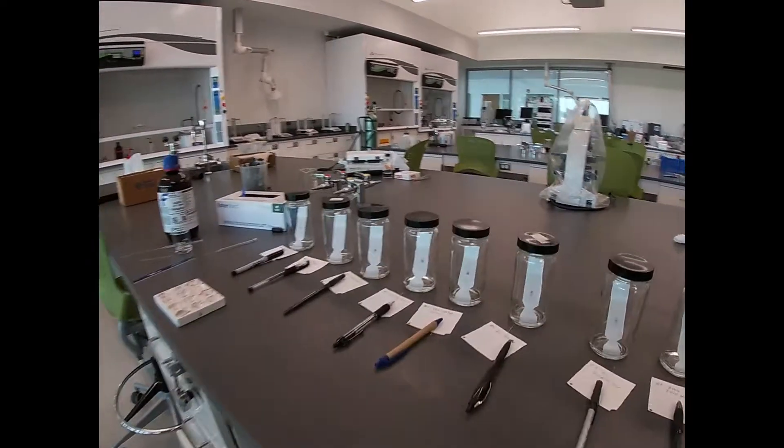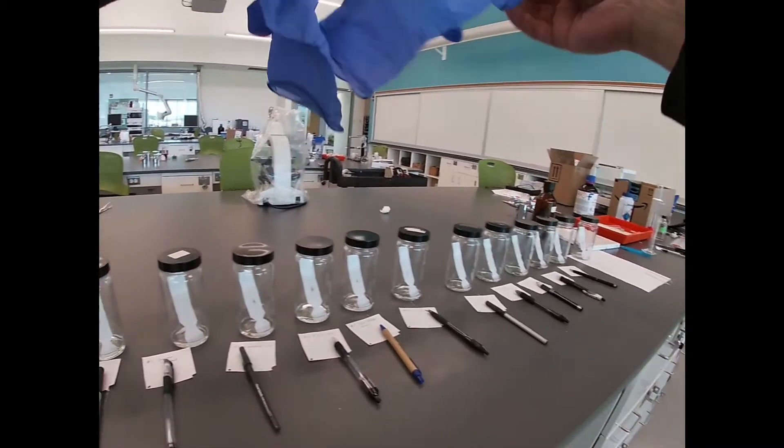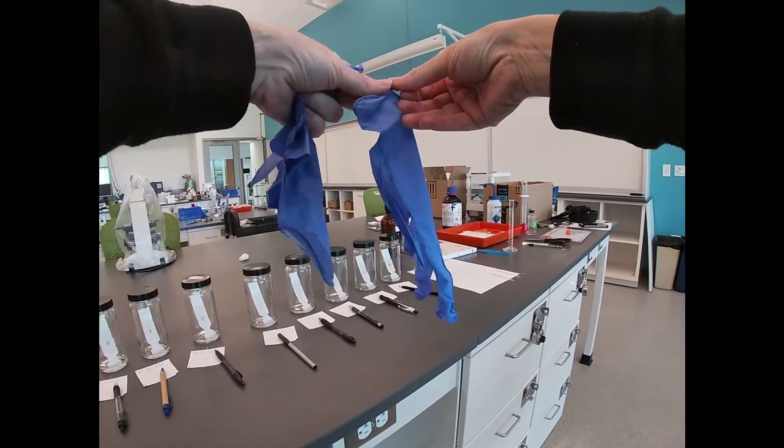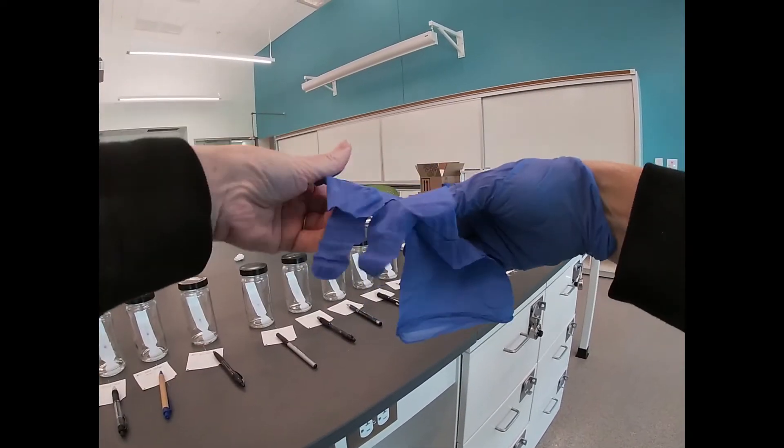All right, so it looks like our separations are just about done. Let's put on some gloves, pull these out, and we need to mark the solvent front, and we can let them dry and make our measurements.